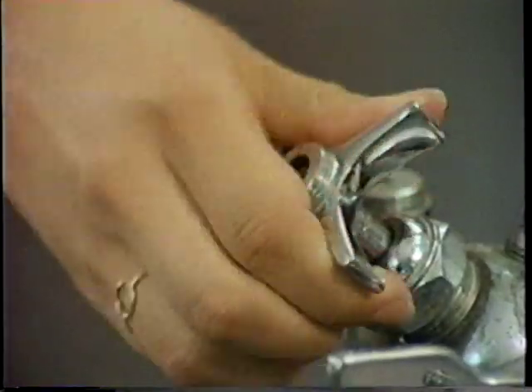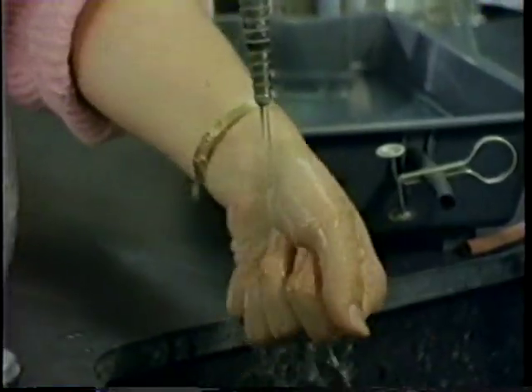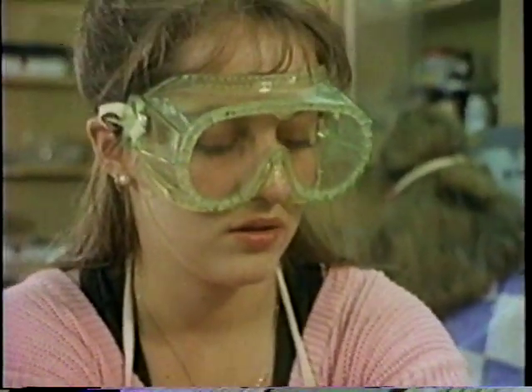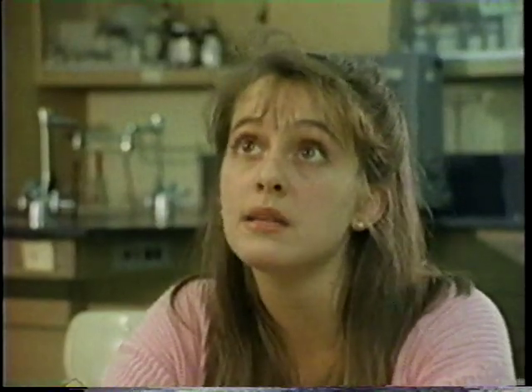Okay. Now, I know you were careful and all, but let's just suppose that you had spilled some of that acid on your skin. What then? Acids and alkalis will burn your skin. You gotta get it off fast, using plenty of running water. And if you should ever get some in your eyes, you should rinse them for 15 straight minutes. I could see this kid wasn't going to fall for any cheap tricks. Anything else? No. That's about it.